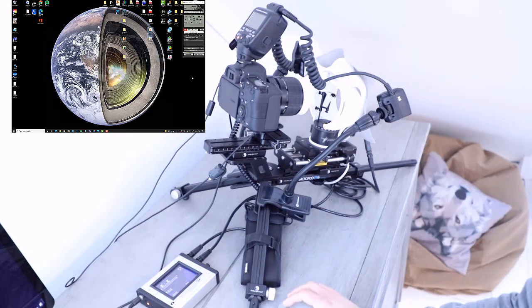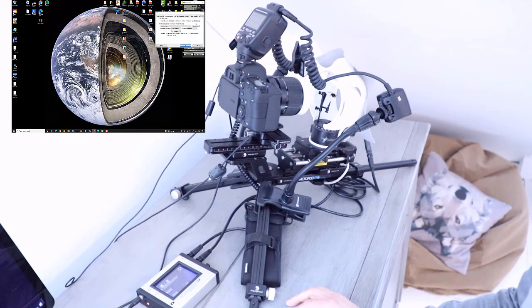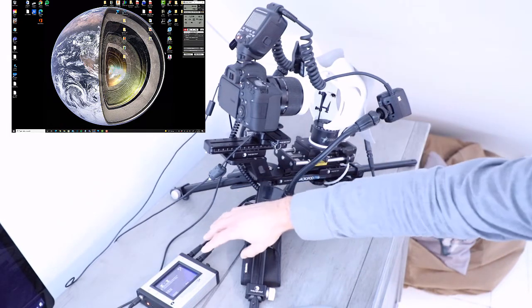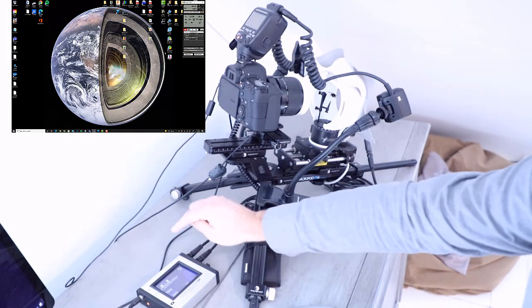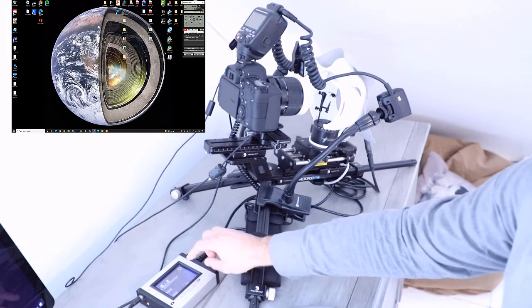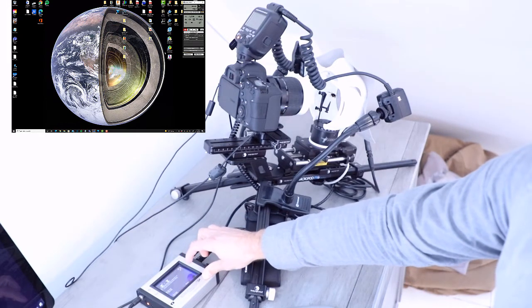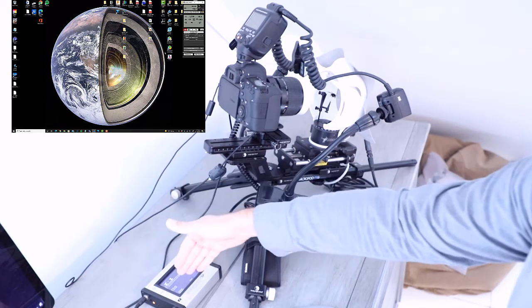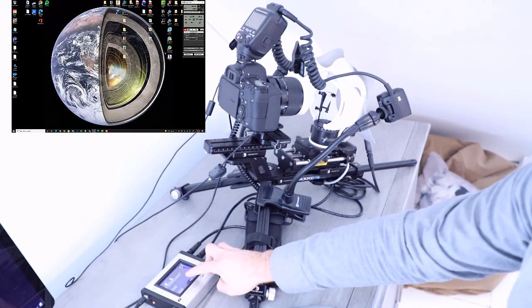The other thing you want to do, navigate back to your folder, and again, go to File Name and change the start back to 0, press OK, and everything else is good to go. So your X-axis is still set, your Y-axis is still set, all your flash and camera settings are correct. You want to turn back to the screen where your axes are linked. So this is the X ready and the Y ready, and just press Start.